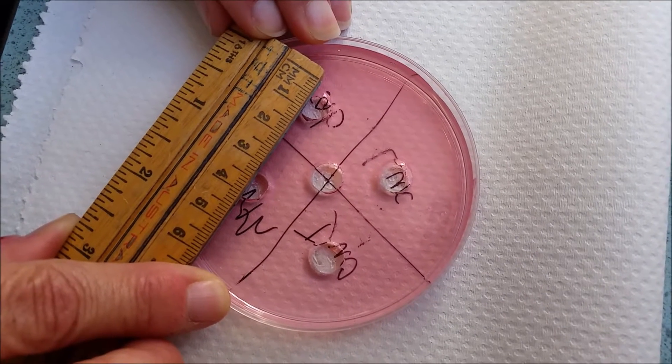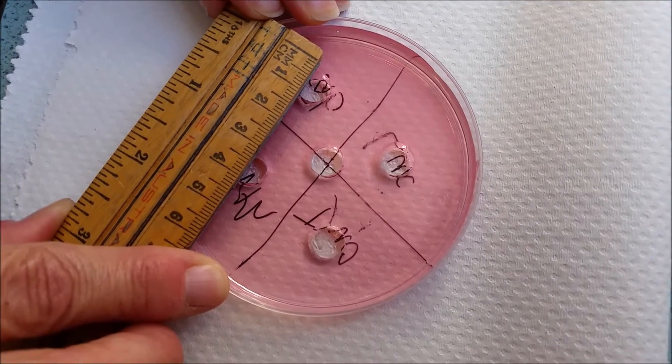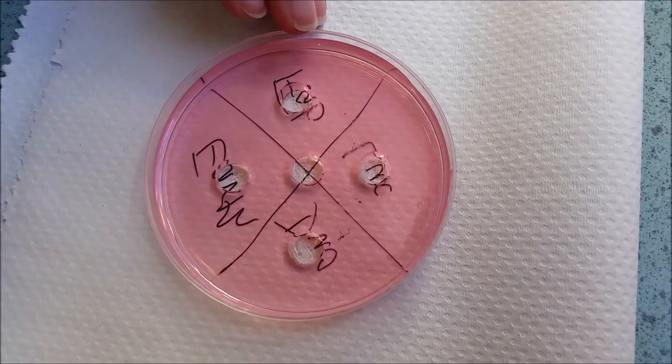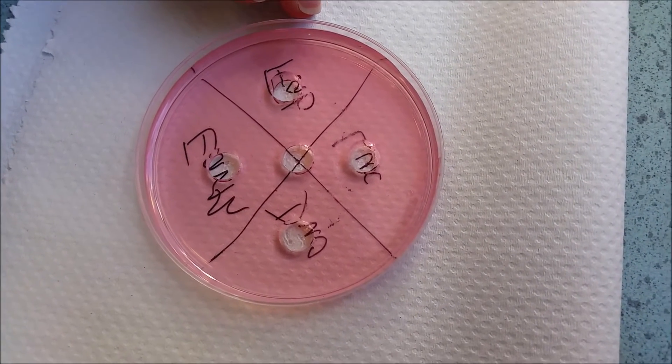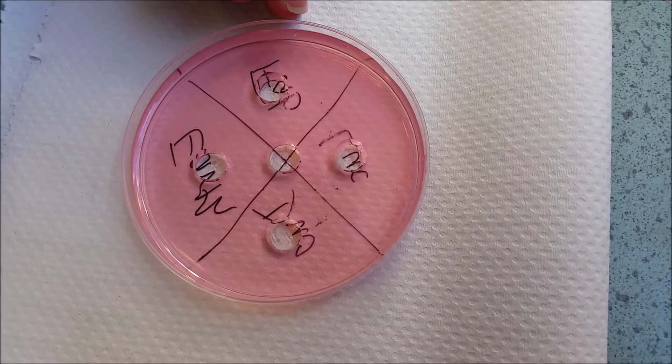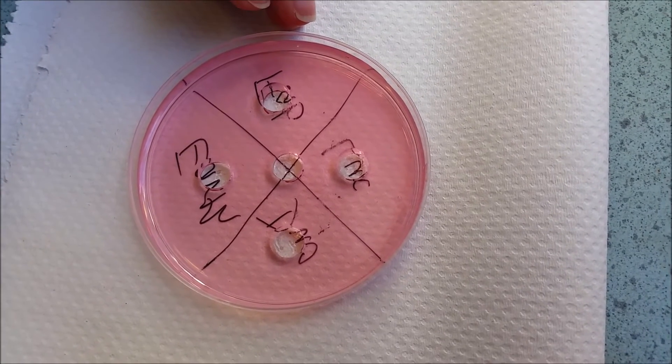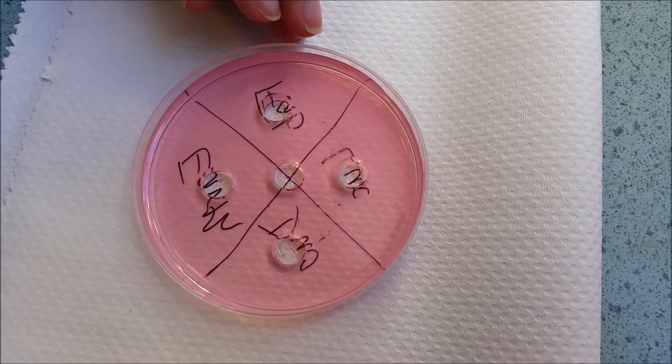The reason you'll be measuring it now, before you add the laundry detergent, but you'll also measure it at the end and that's one way to help you get an indication of how much damage has actually occurred with the laundry detergent and whether it's got enzyme activity or not.